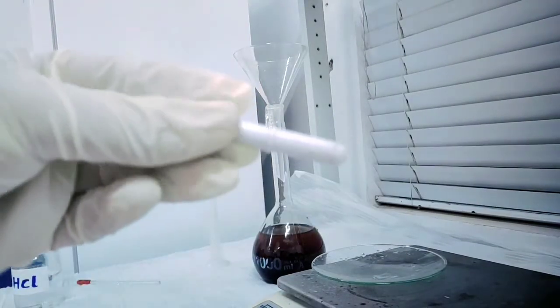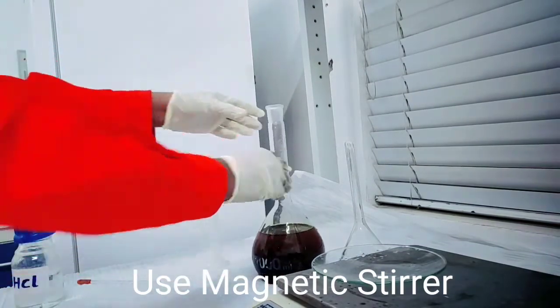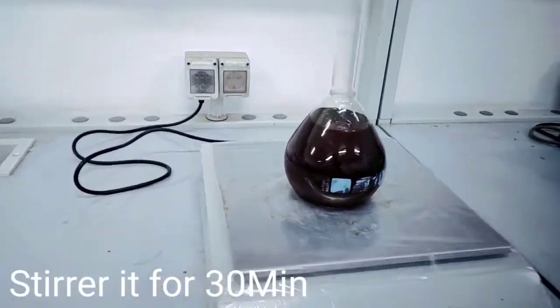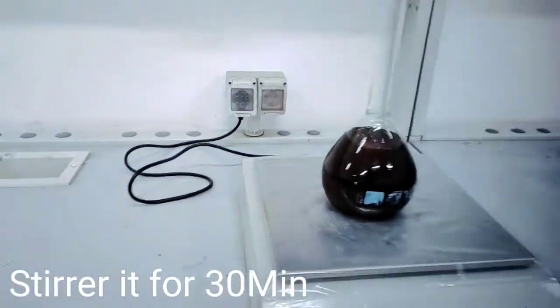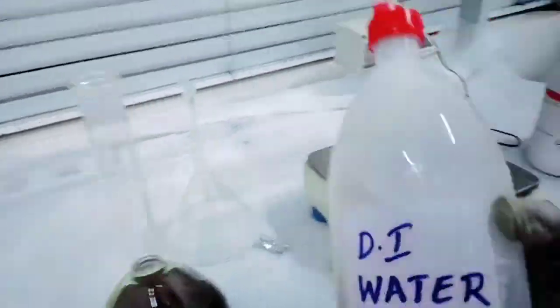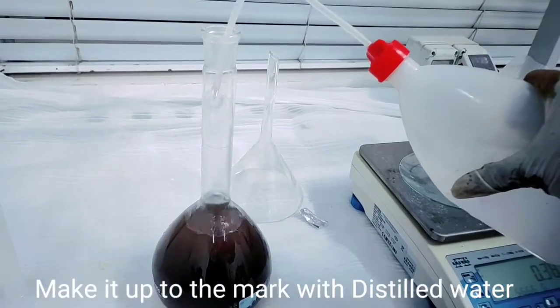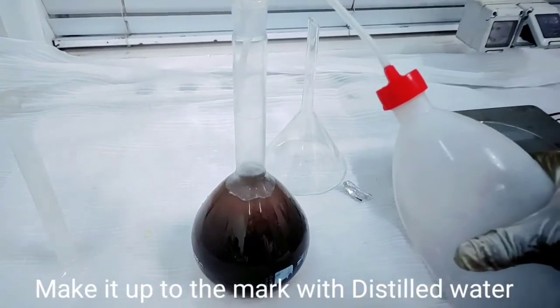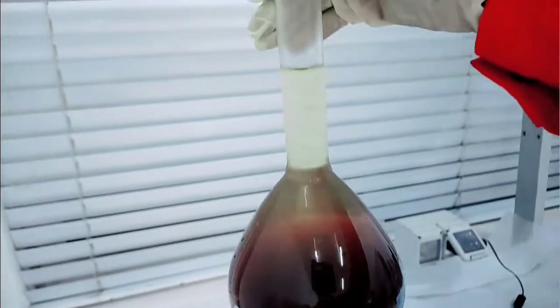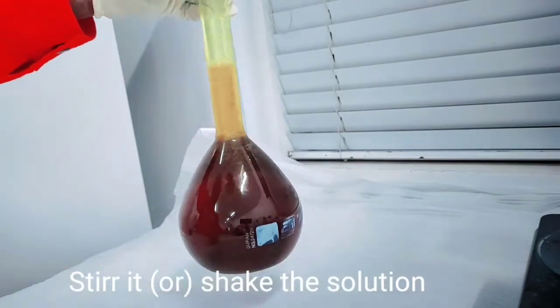Pour approximately 700 to 800 ml of distilled water. Use a magnetic stirrer, put it into the volumetric flask, and place it on the stirring plate. Stir for 30 minutes, because we need a homogeneous solution — if you need to stir for more time, that is no problem. Make it up to the mark with distilled water only. If we use normal water it contains chlorides, which will affect the analysis. Shake it or stir it on the hot stirrer plate.